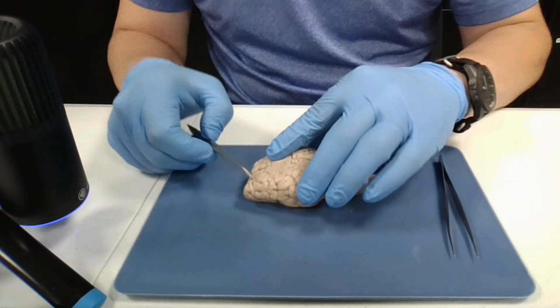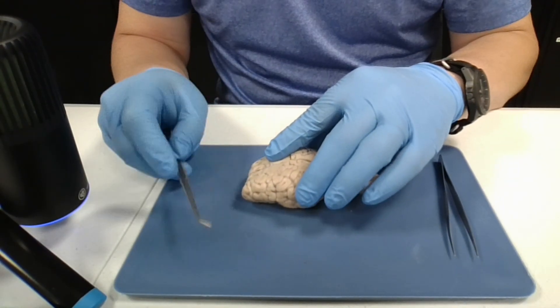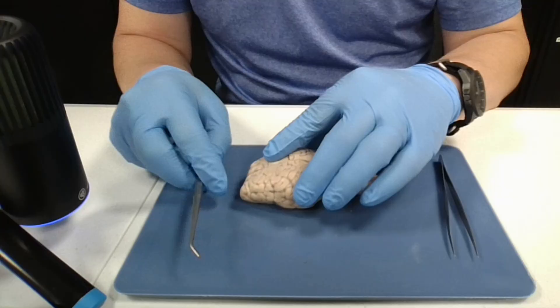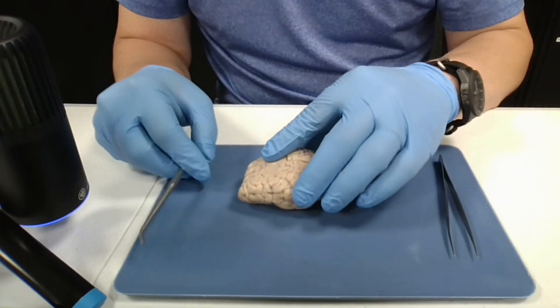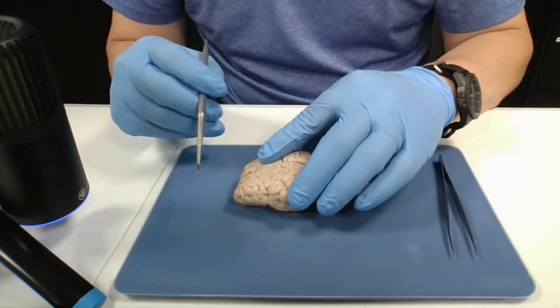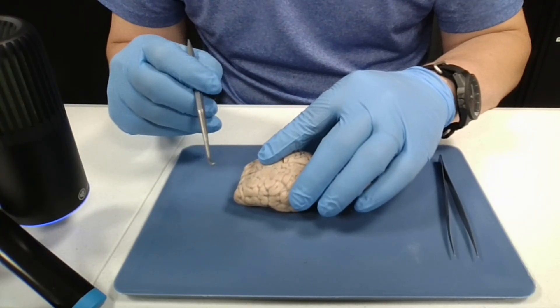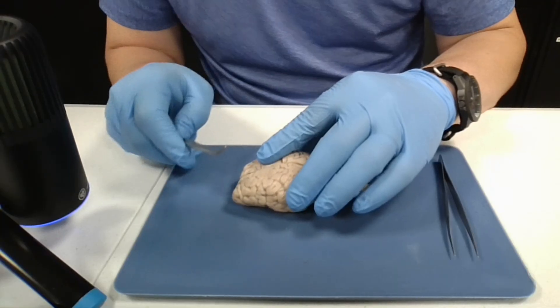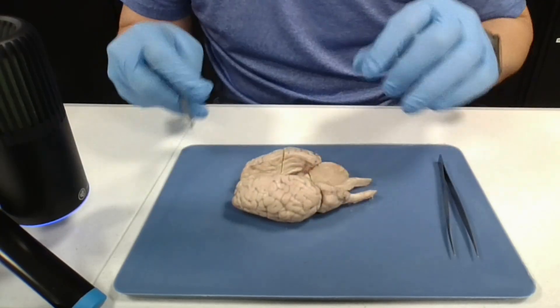Hello, I'm Chris Hansen, and this is my sheep brain practical. The first thing I'd like to point out is the outer meninges: the dura mater, arachnoid mater, and pia mater.